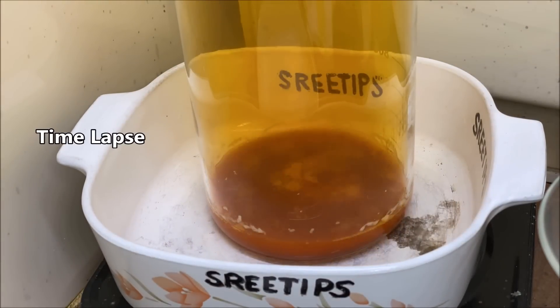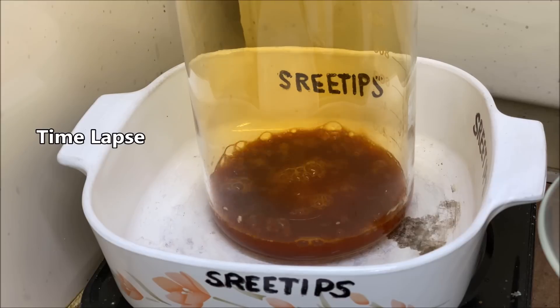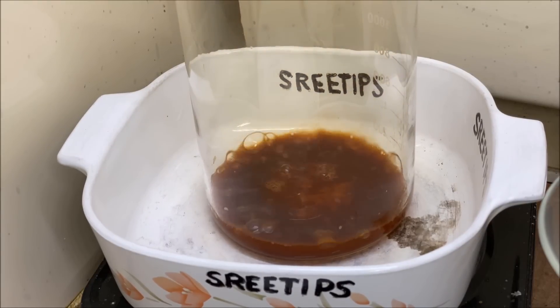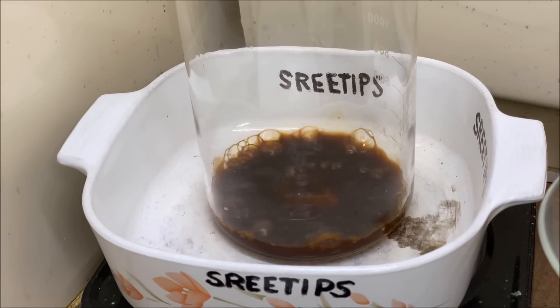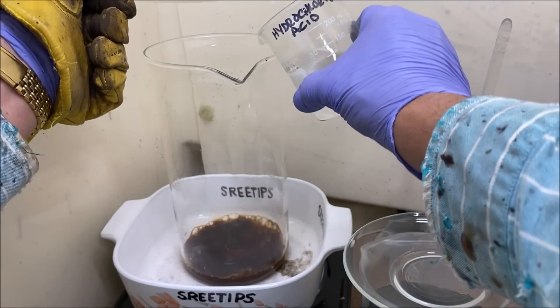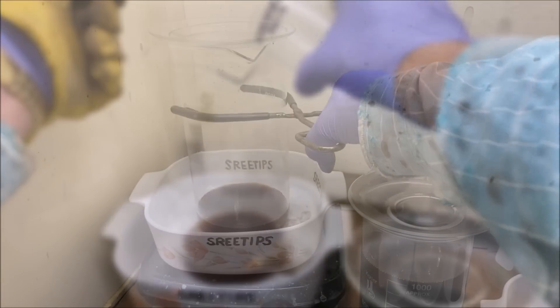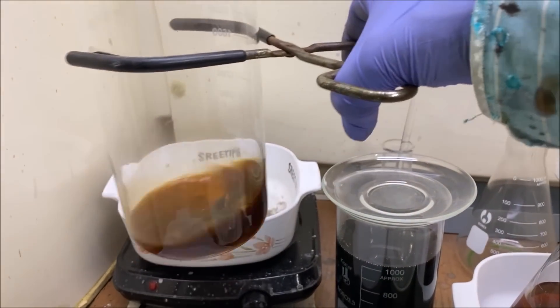This is a time lapse of about 20 minutes or so — I'll let the solution boil down to a syrup to drive off all the excess nitric acid. Now we'll rehydrate the solution with a little bit of hydrochloric acid, then pull it down off the heat and allow it to cool.